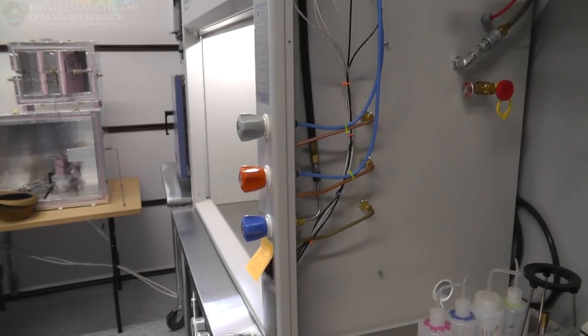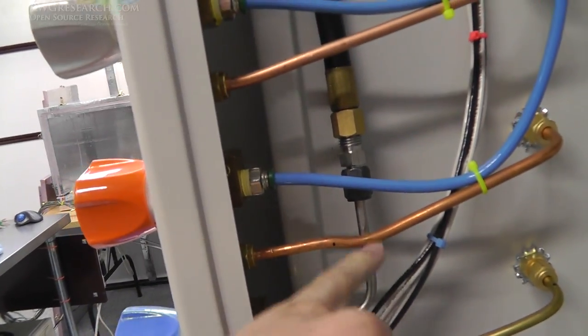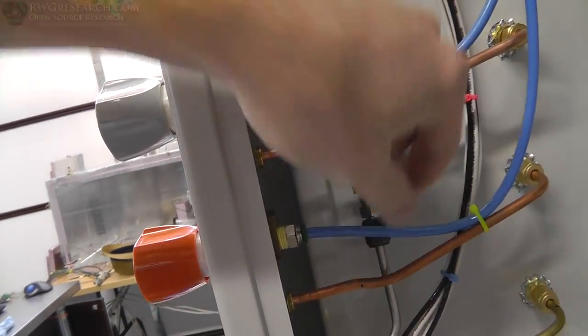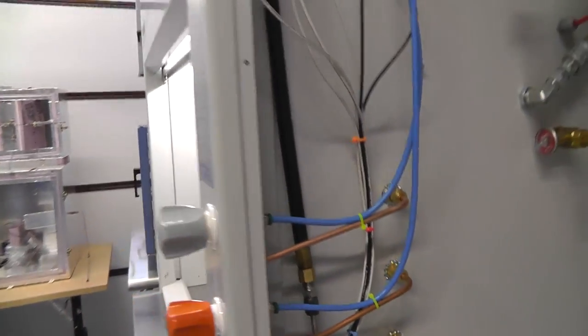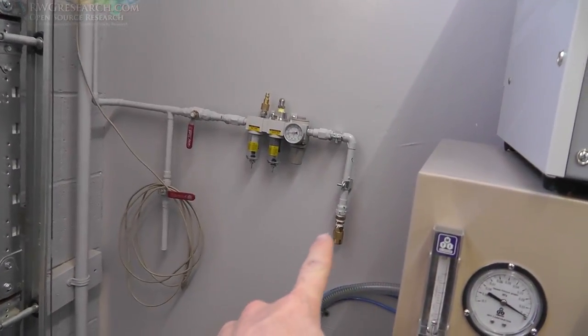Okay, so here we are. We've got all this plumbed. I managed to put different fittings here instead of the compression fitting. I needed that compression fitting to get this to work out right because this gas line's different. But the air incoming and the argon incoming, I've just plumbed them out. This is the argon right here. And then I'm just going to put a T fitting and connect it right there.